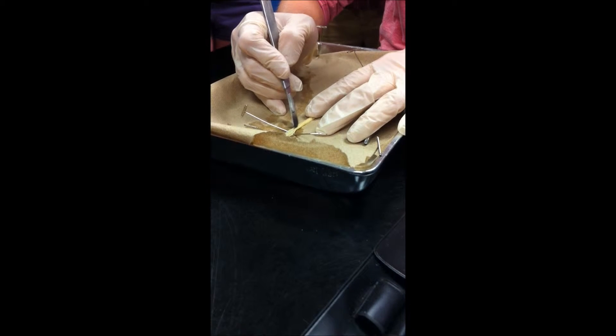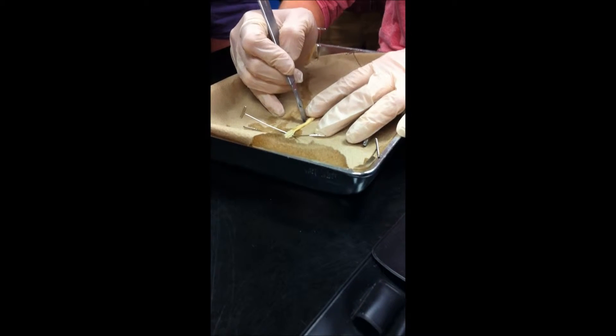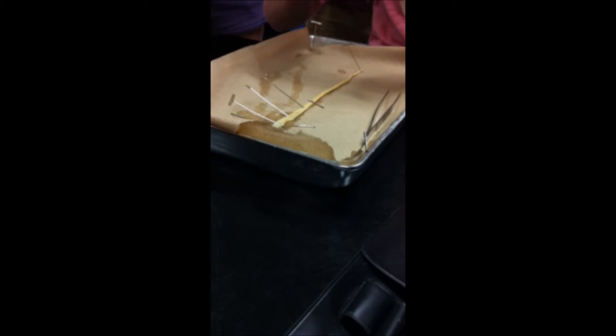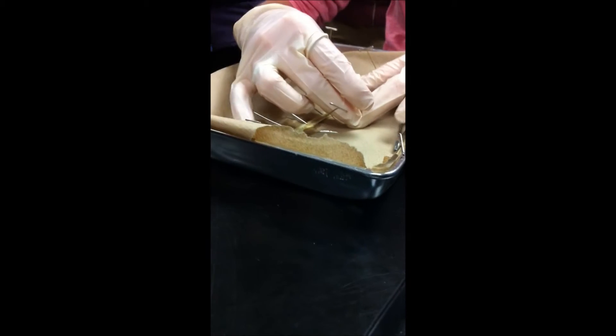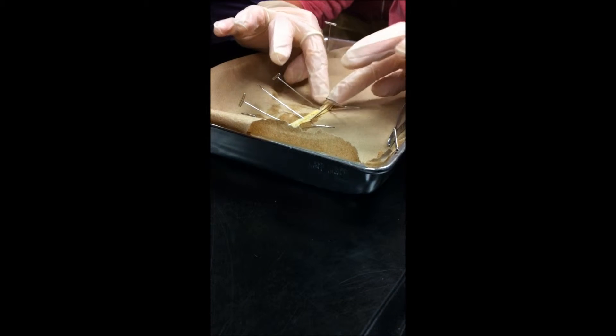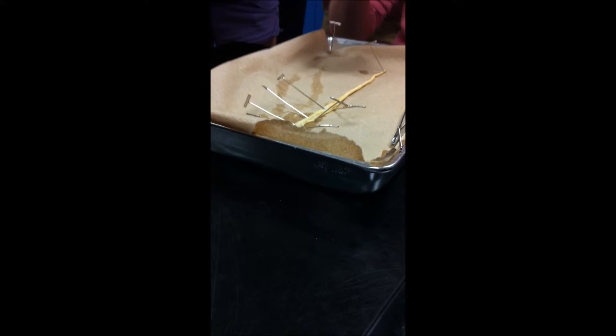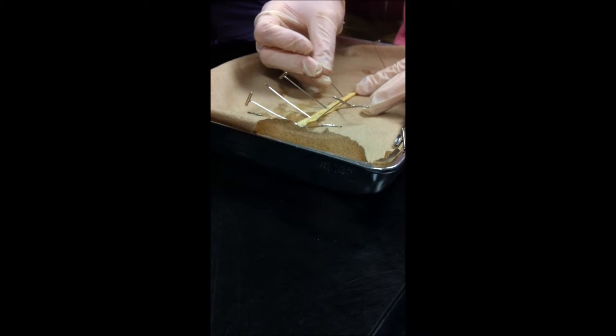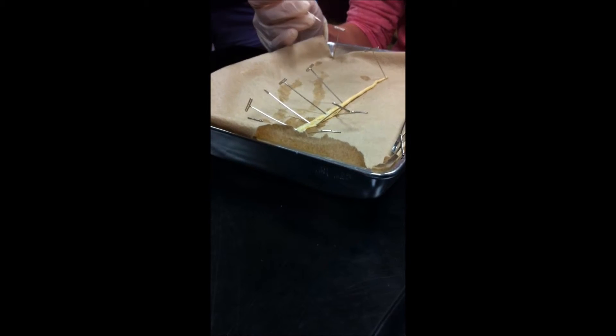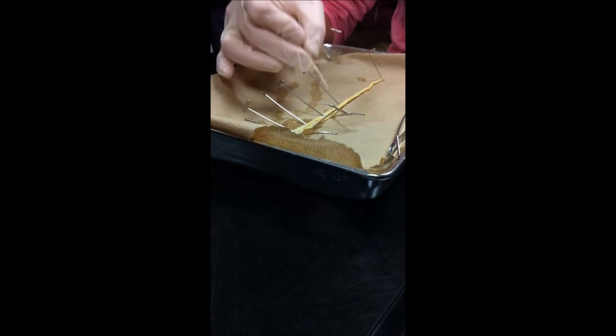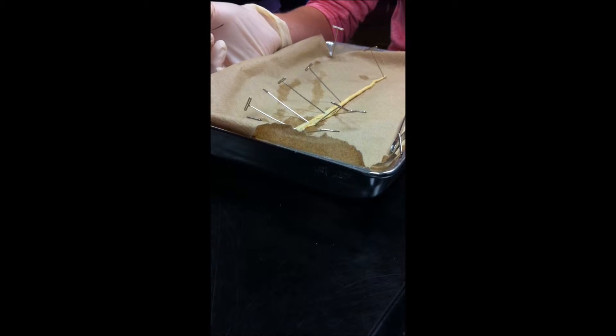I'm going to continue to cut. So you'll notice I'm just peeling and pinning the skin back, right? And by just pinning the skin back, I'm exposing everything inside. And it's literally like there's a bunch of stuff, looks like noodles, sitting inside the body skin. There's nothing holding it together. There's no muscle between the two. There's just like an open cavity. Do we all see that? That's the pseudocoelom. All this open space here, that's the pseudocoelom.